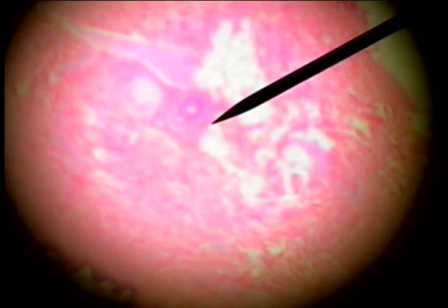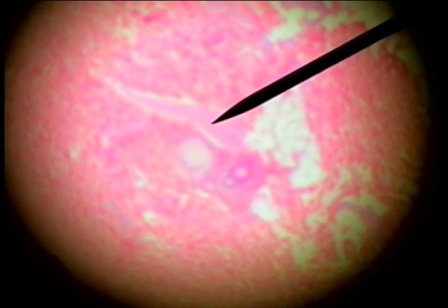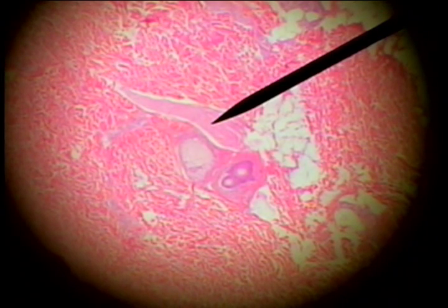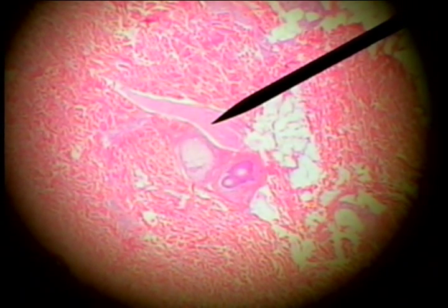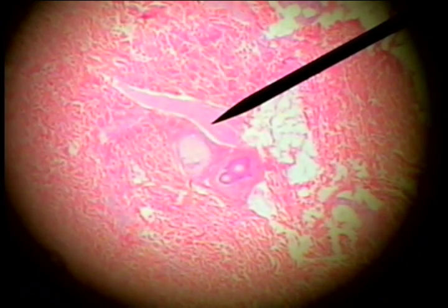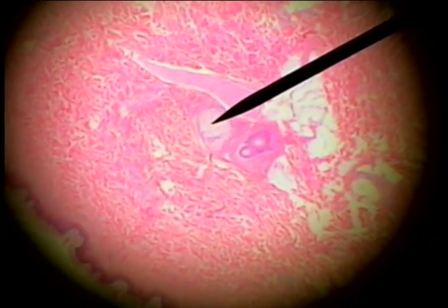Adjacent to the hair shaft, and capable of pulling the hair into an upright position, is the erector pili muscle. It's smooth muscle situated close to the hair follicle, and we can see this is smooth muscle.